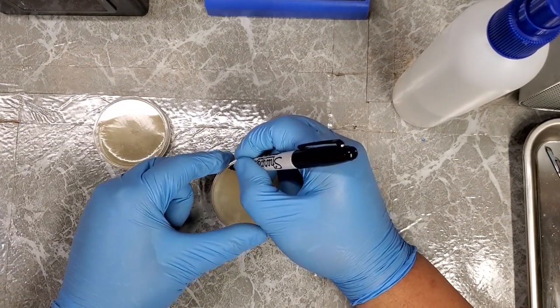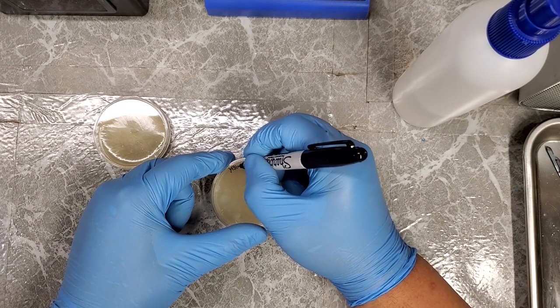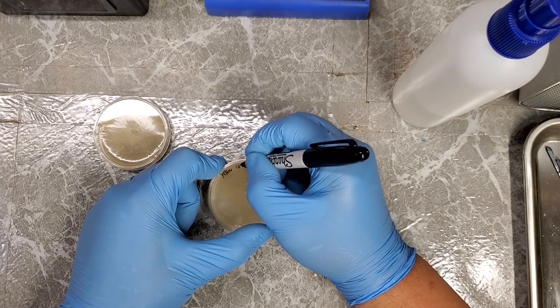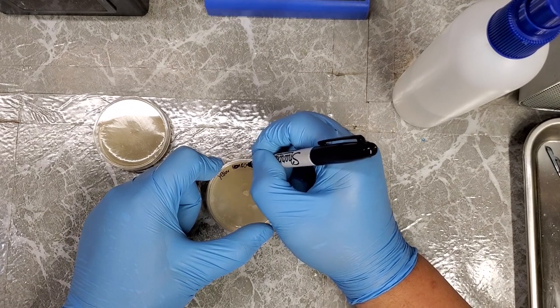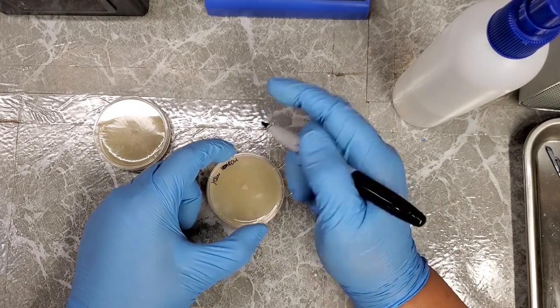And this is another reason why I like to use QR codes for my final labeling system. Because my handwriting is not that great.